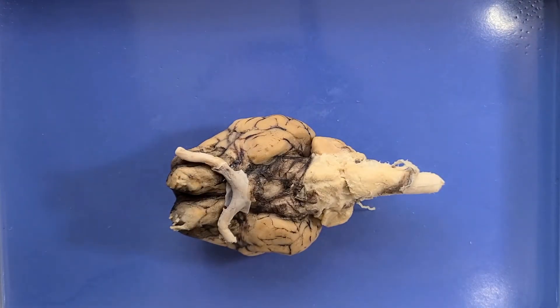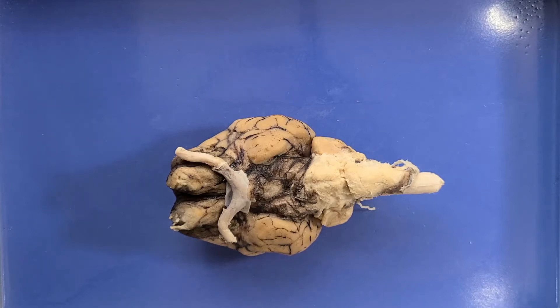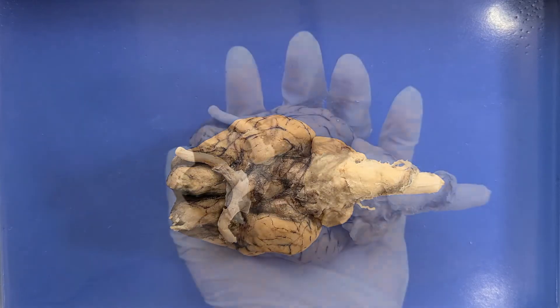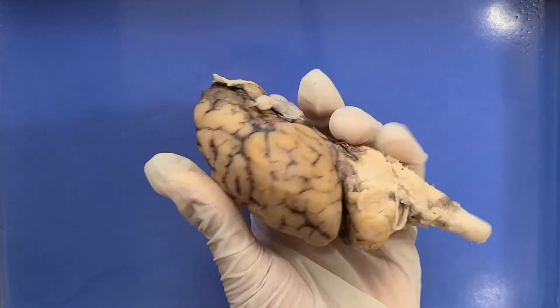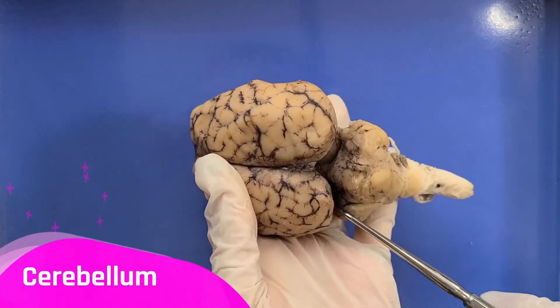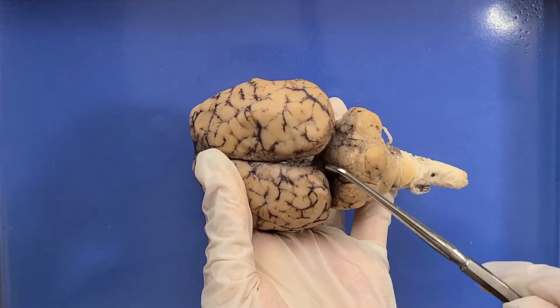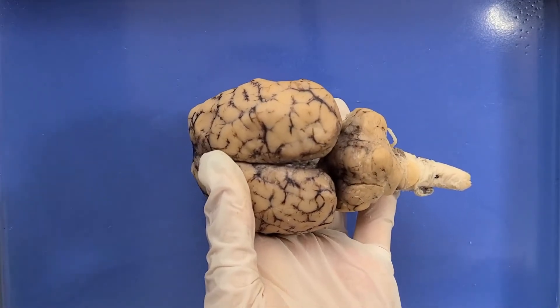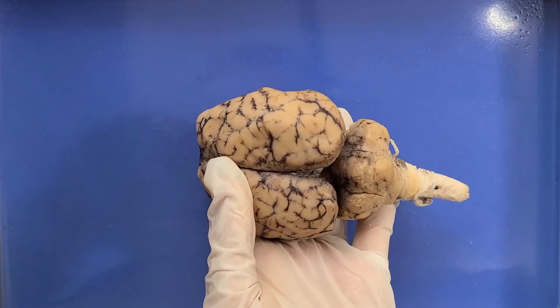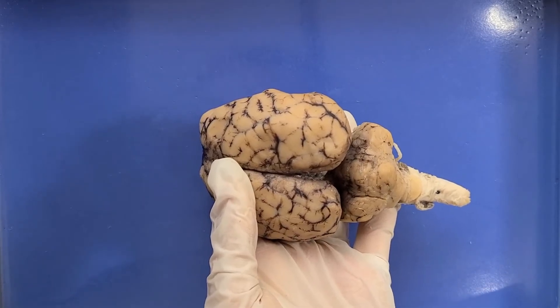So these three parts — the pons, medulla, and midbrain — make up the brain stem. This structure here is the cerebellum, which plays an important role in motor control. As I lift this brain right now, my cerebellum is coordinating my arm with my brain to make this movement possible.